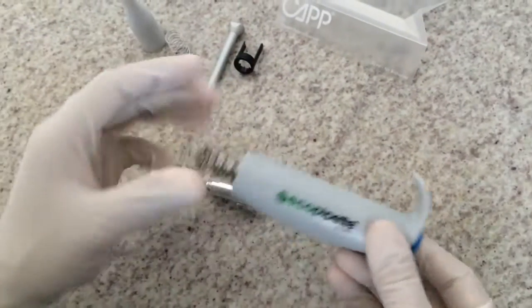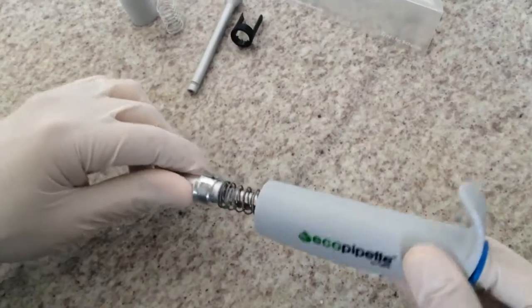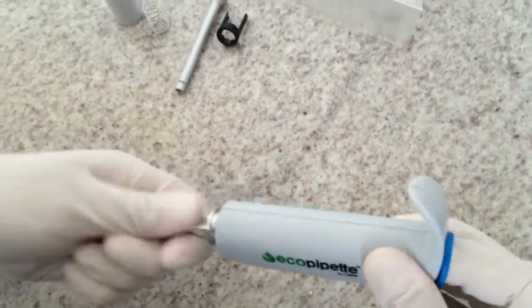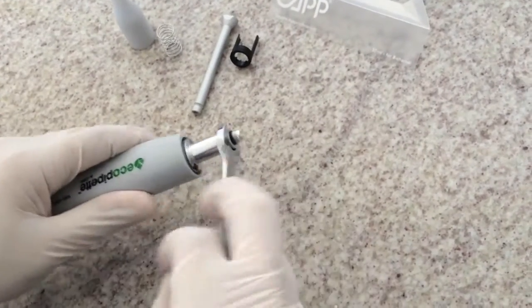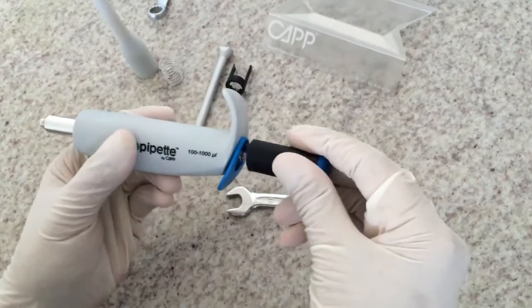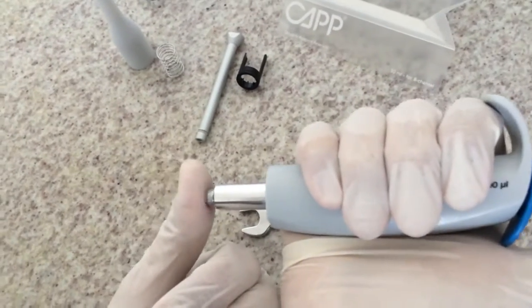Then I'll place my index finger in the back side of the pipette to assist in connecting the pipette body into the bottom part. Always tighten it gently. And once you finish this part of the assembly, you can put the volume controller back and make sure that there is a tight seal.